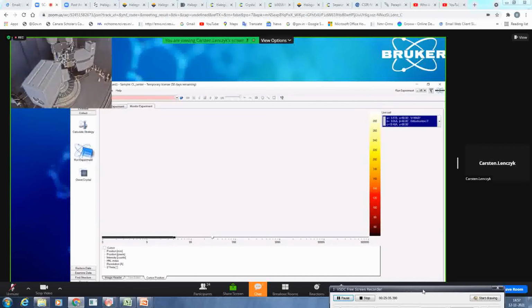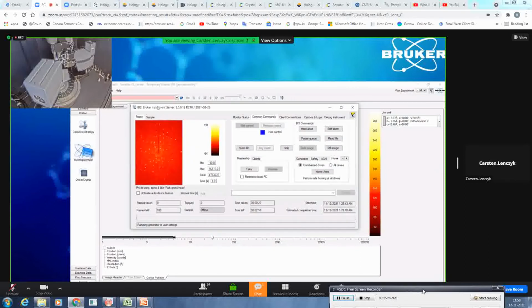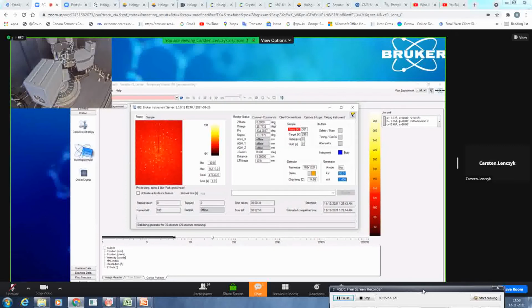So we have to wait a little bit because now it tells us it has to ramp up the generator because it was in standby mode. It's always listed here what it is currently doing. You can, of course, also check on the BIS, this is the Bruker instrument server, and there you get all the information that you need. So here you see it's stabilizing the generator.